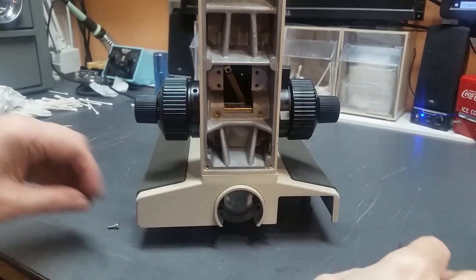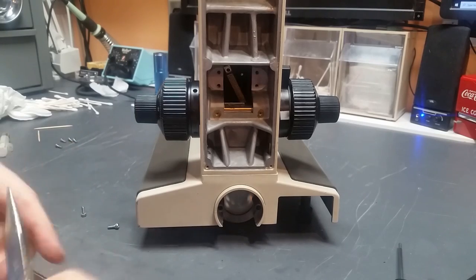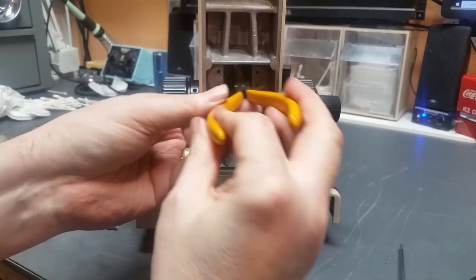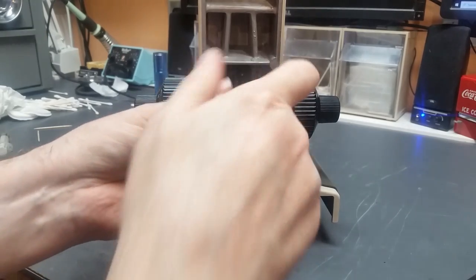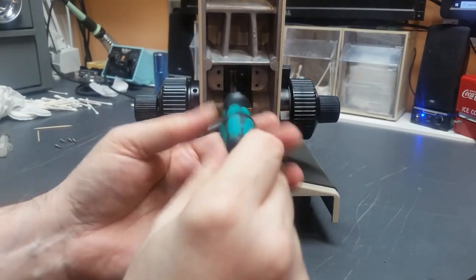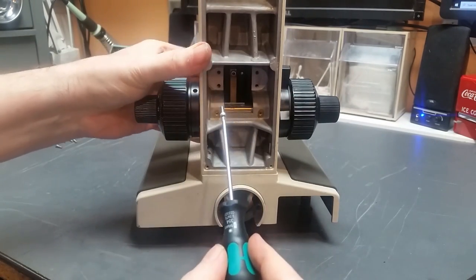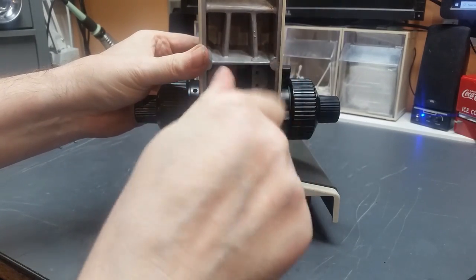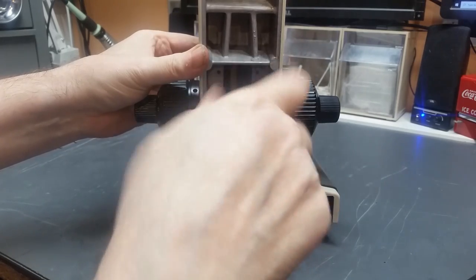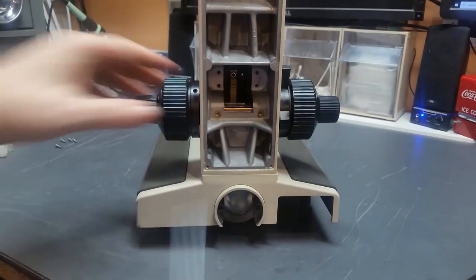Let's take the screw back out. And let's use a pair of needle nose pliers. Try to get her in position that way. Once we do that, then we'll hang it. Awesome. Okay, so I take the screw, pick up the rack, and get the screw started. That's still loose, it's not tight yet. Reach around, raise the sliding focus block, and put the second screw in. Now at this point I can go ahead and tighten them down. Alright, so the rack is installed.